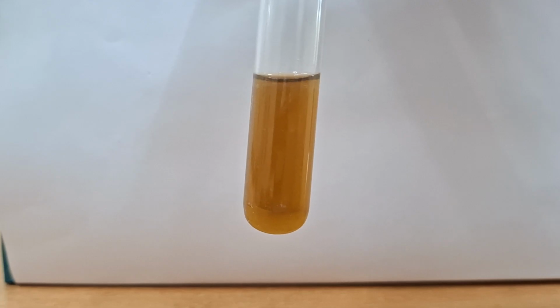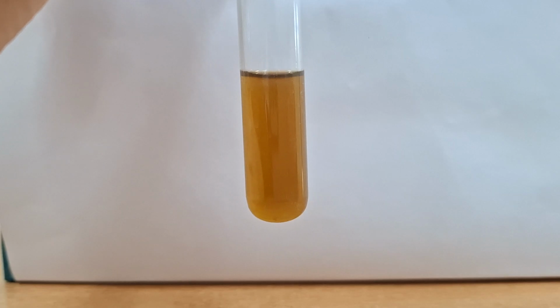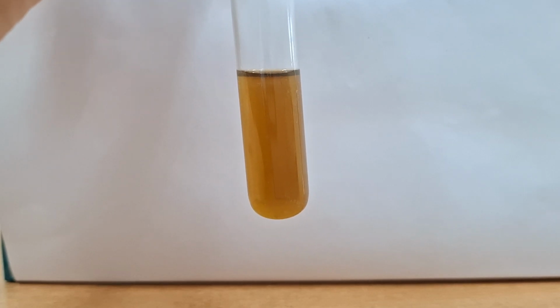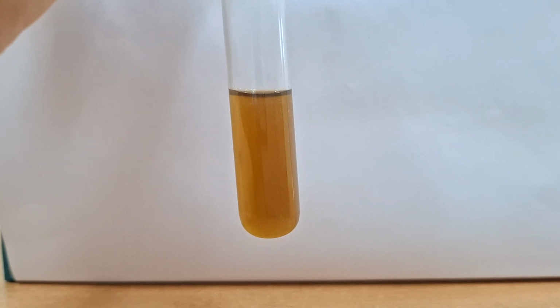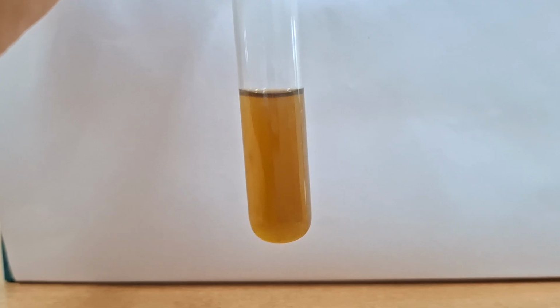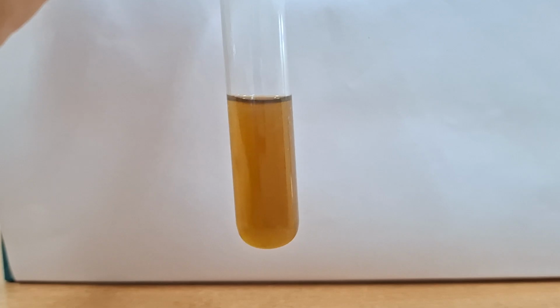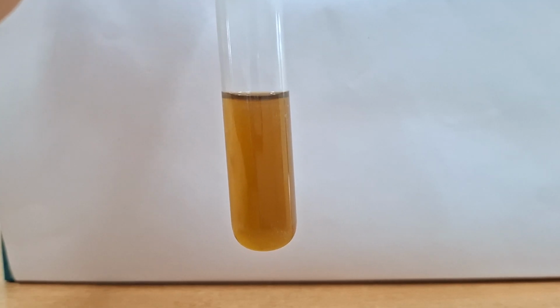the organic sulfur is converted into inorganic sulfide, and addition of lead acetate to this solution forms a black color precipitate of insoluble lead sulfide. So the black color precipitate is due to lead sulfide. Methionine does not answer this test due to the presence of a thioether linkage. In methionine, the thioether linkage does not allow the release of sulfur, because the sulfur is in the middle, surrounded by 2 methyl groups. So the methyl groups do not release this particular sulfur, and methionine will not show a positive reaction.